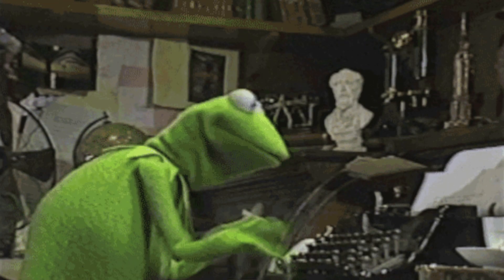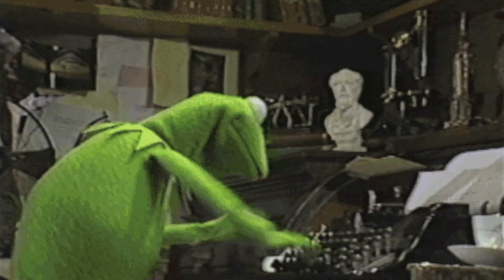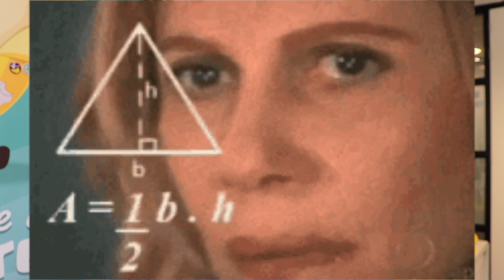I prefer to take pictures and count on my computer while drinking a cup of coffee. Some people prefer to count directly under the microscope, and others prefer to use software like Photoshop or ImageJ. Once you have your count, just make calculations based on the size of the pot, size of the plant, and number of plants. Make your dilutions and you are ready to inoculate your plants.